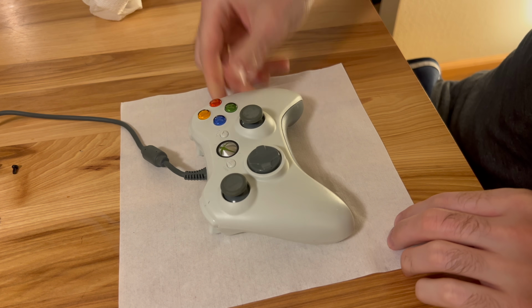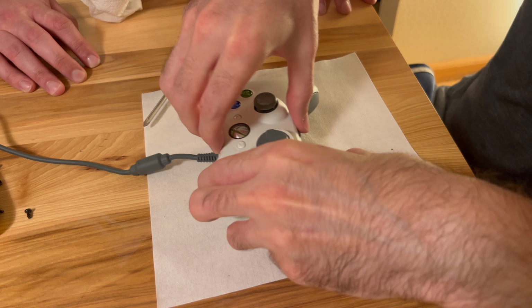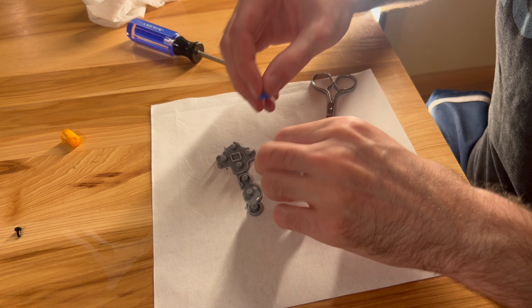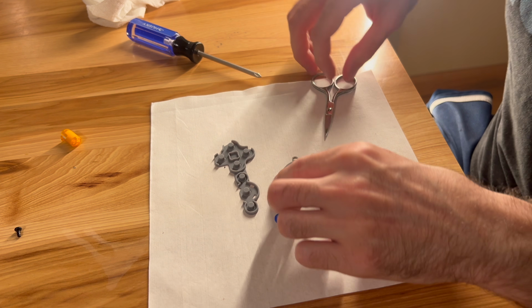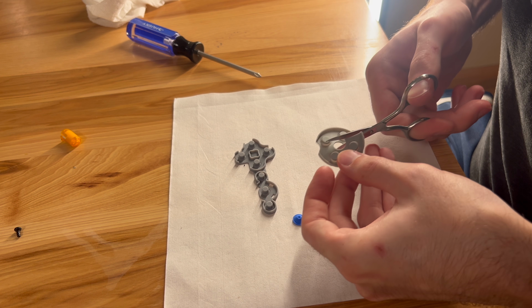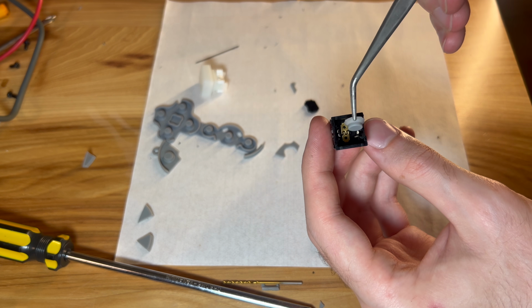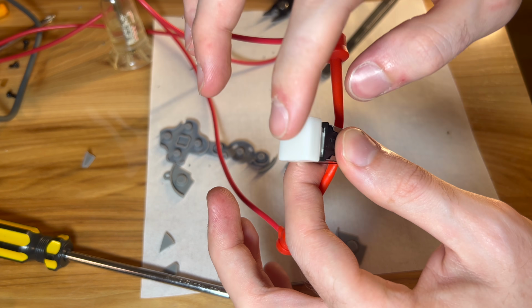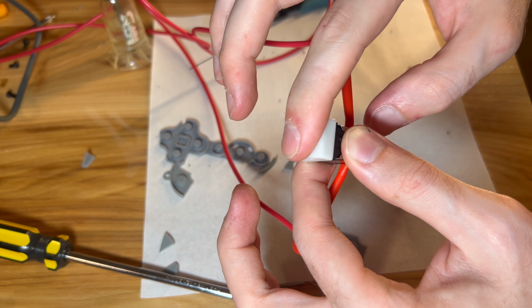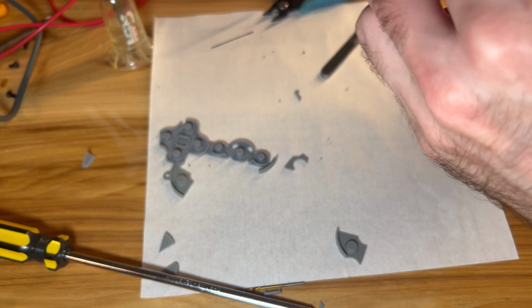I happen to have this old Xbox controller that I don't use anymore, so it's going to become an organ donor for my SEM. Luckily, I only need 4 membranes, and it looks like the membranes on these keys are just about the right size to replace the originals. I just need to carefully cut them out since they are all fused together. Okay, that looks good. Let's reassemble the switch and see if that fixes it. Success! Well, that's awesome. I fixed the other switches in the same way.